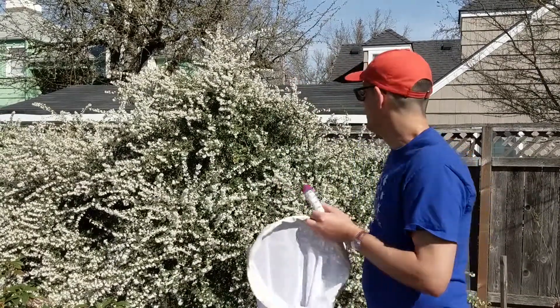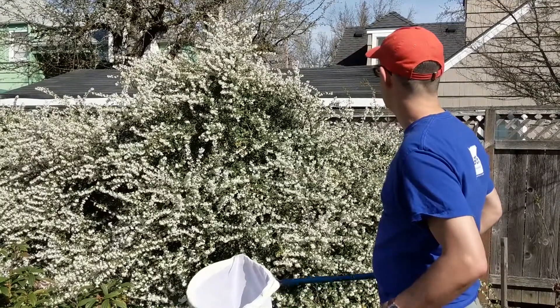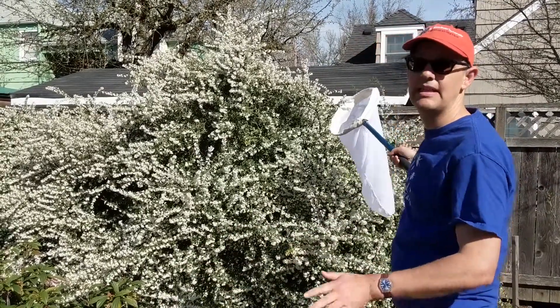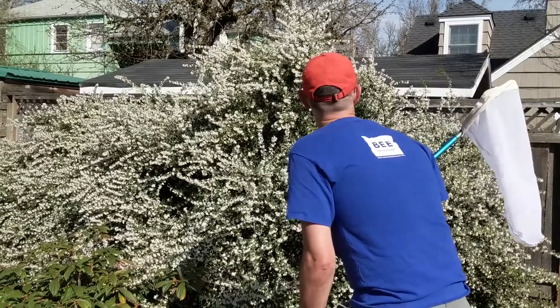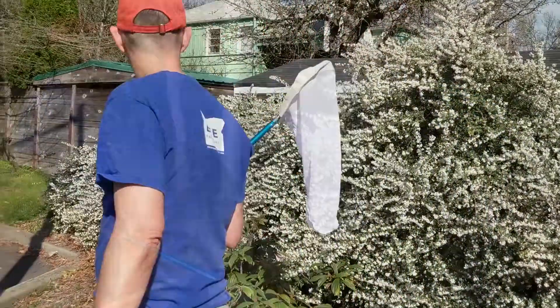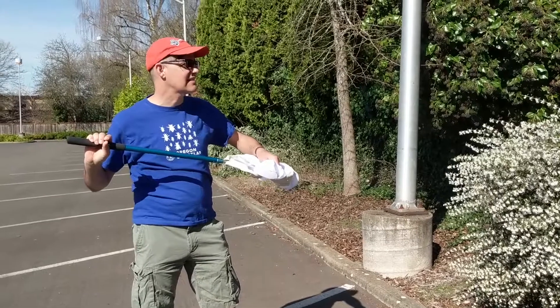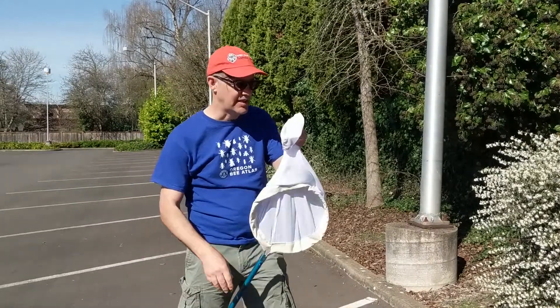The next step is getting the bee, so I'm going to look around for one. The trick here is — I noticed some volunteers are swinging way back, and by the time they get to the bee it's already disappeared. You're going to try to get in close, look around for a bee that's flying, and then line your container up. There's one right now — I'm going to get very close to the mason bee, and then right at the end be very aggressive and very fast to get that bee in the net, because they would have flown off.